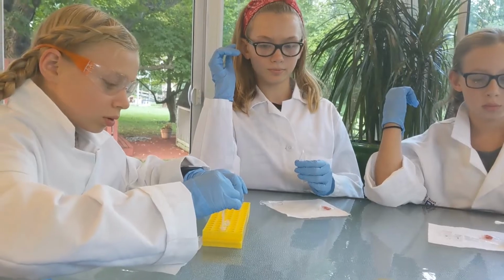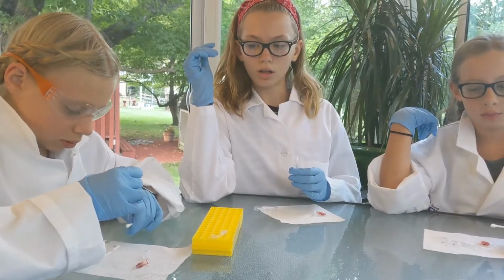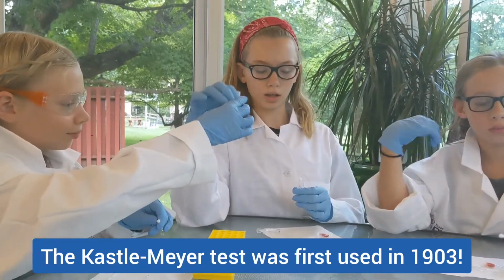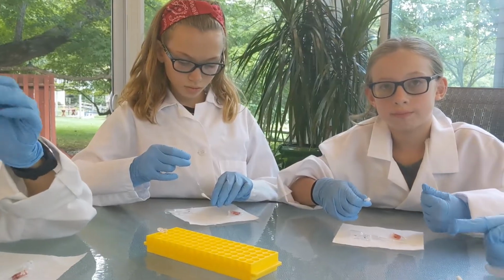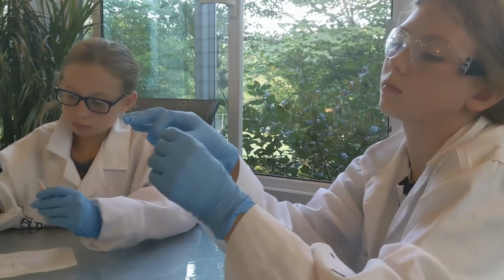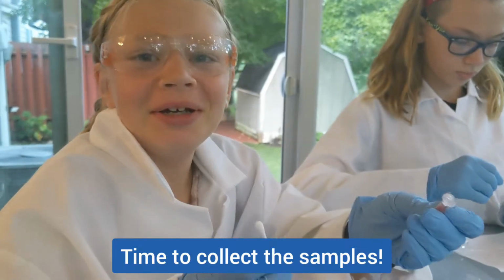So this is the Kastle-Meyer test you guys are doing, and it's actually been around for more than 100 years. Scientists have been doing this test since 1903. Oh, wow. And they've been doing it to test things that are red to see if they might be blood or if they're definitely not blood. Yeah. So everybody take your moistened swab, open up your sample, and dip your swab down into it. Out with the lid.